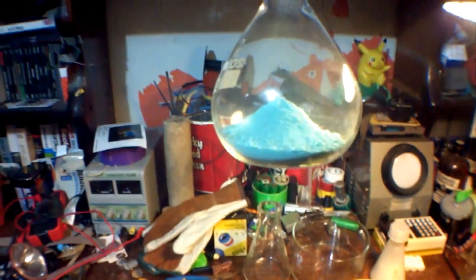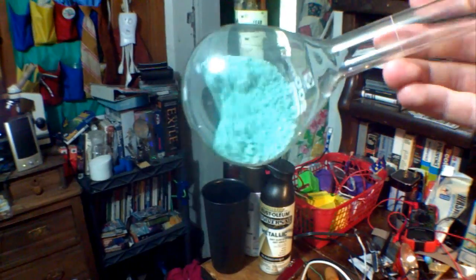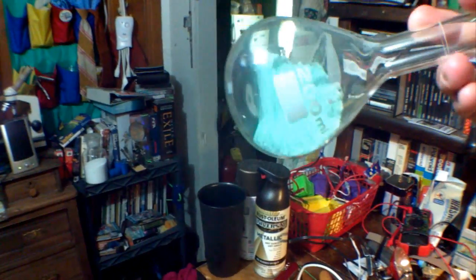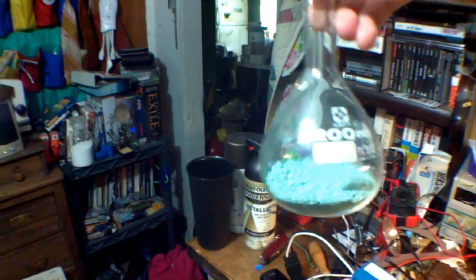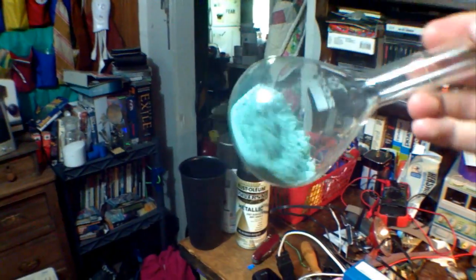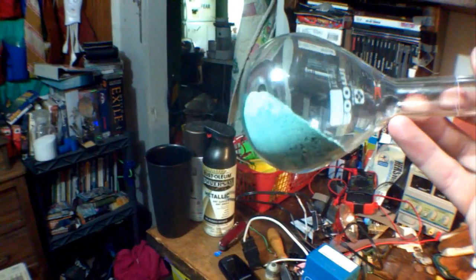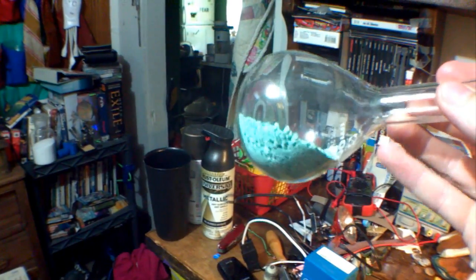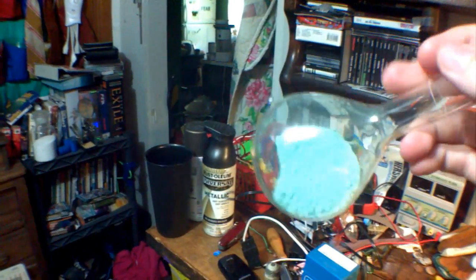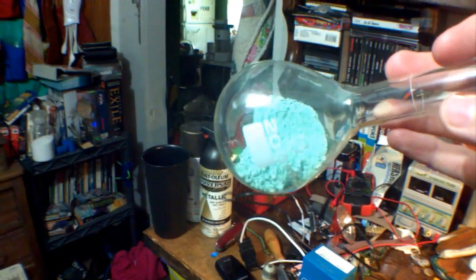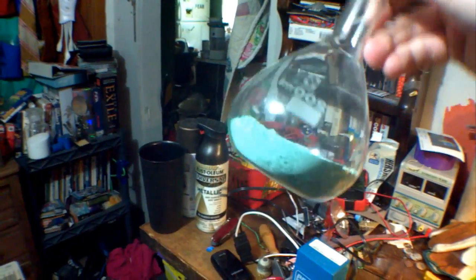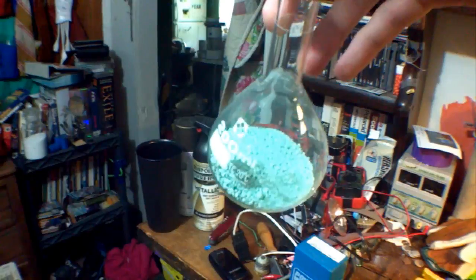There we have copper hydroxide, quite a nice amount of it too. I really like the color—it looks like the sand from a far-off planet. You know how Mars is red because of all the iron? Well, I wonder what a planet would look like if it had an overabundance of copper. Possibly something like that. That would be so awesome.